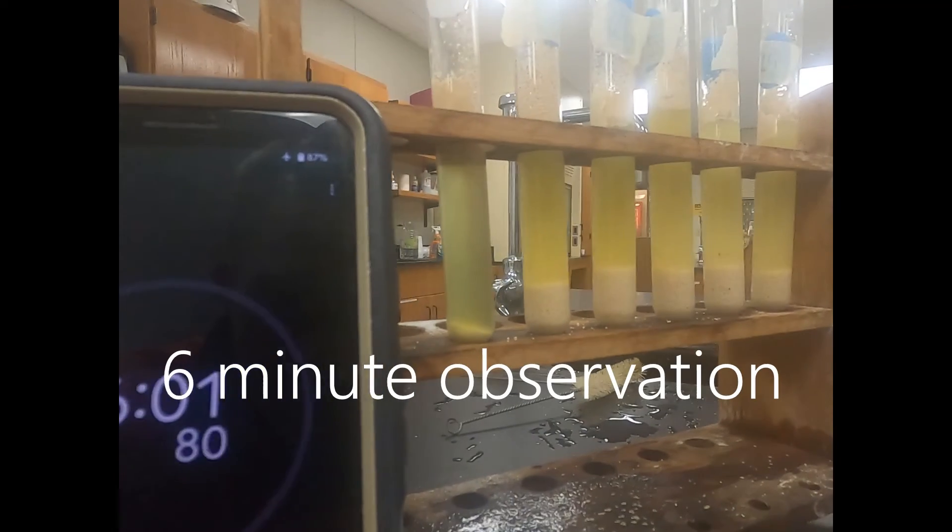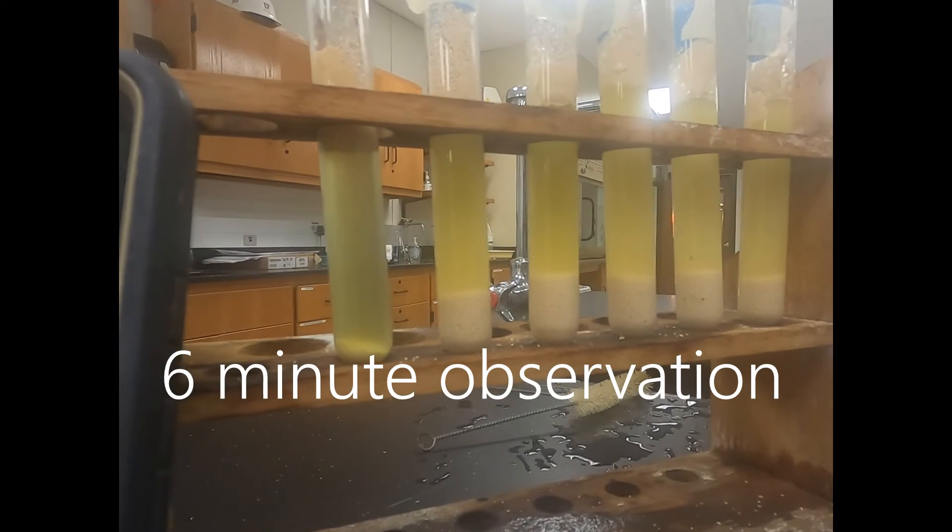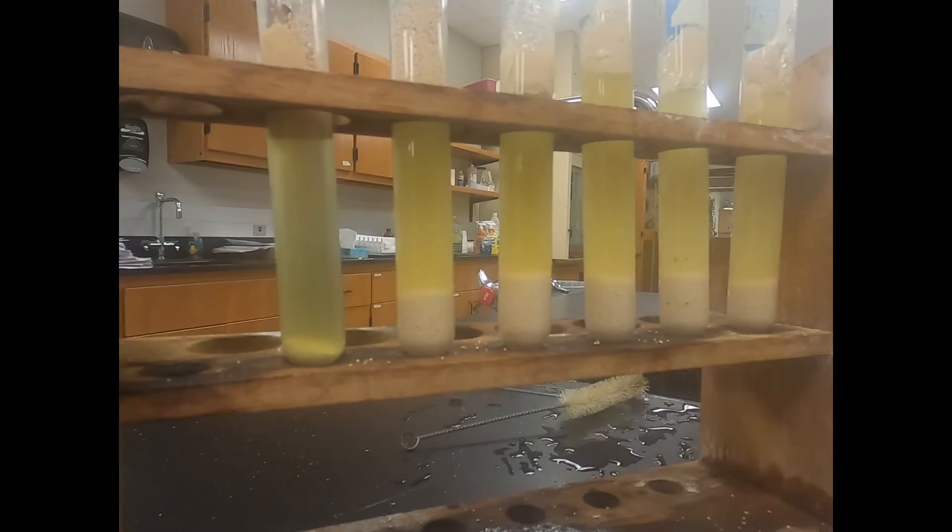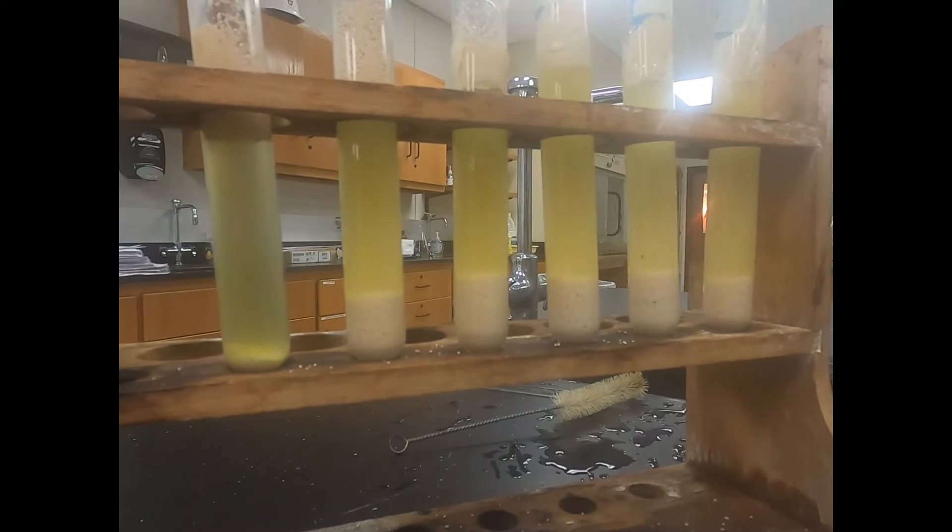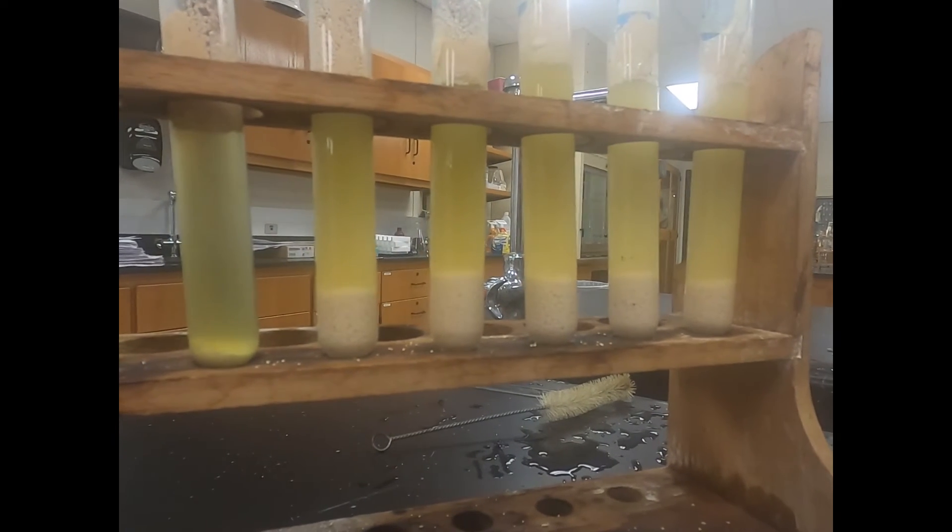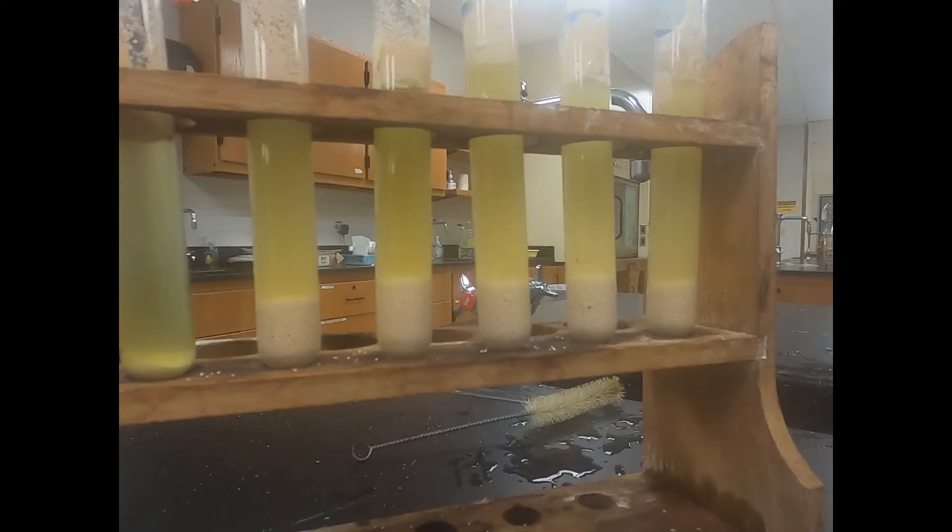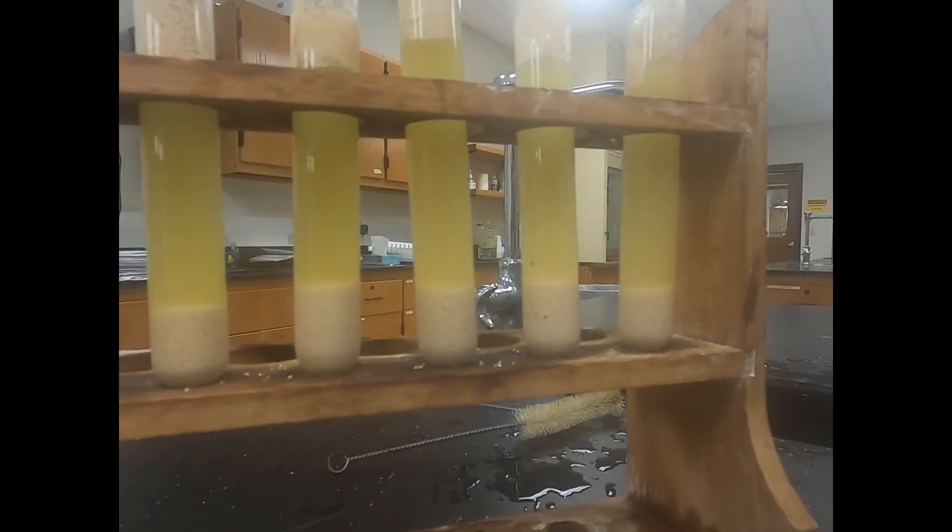Now it's been six minutes. Again we're looking at changing color and how it may be different between these different test tubes. Record your coloration. If you really want to be specific, lighter or darker, make sure you're specific on that coloration.